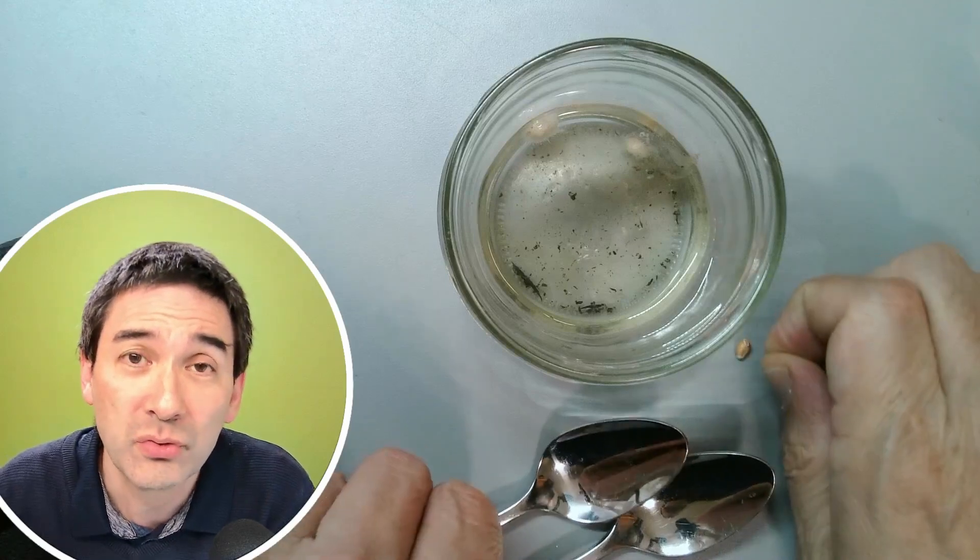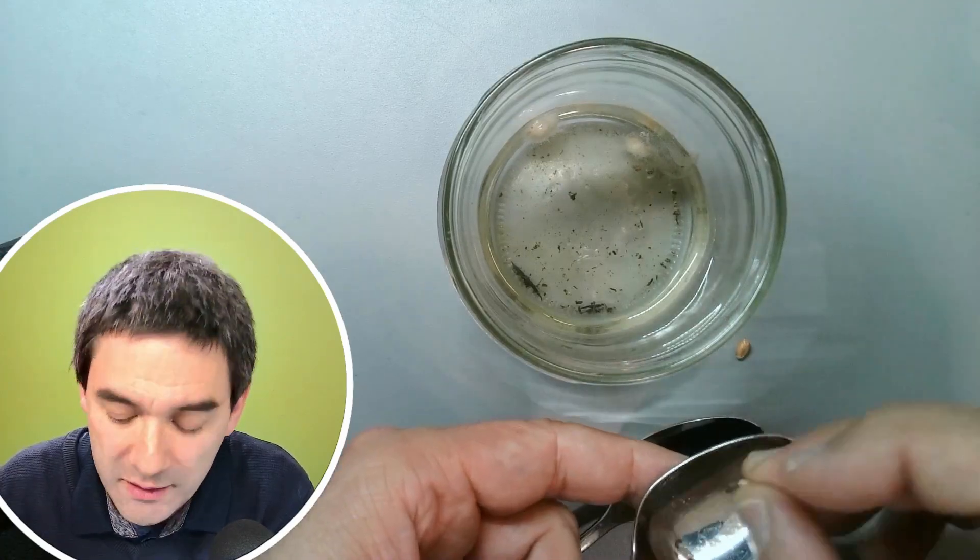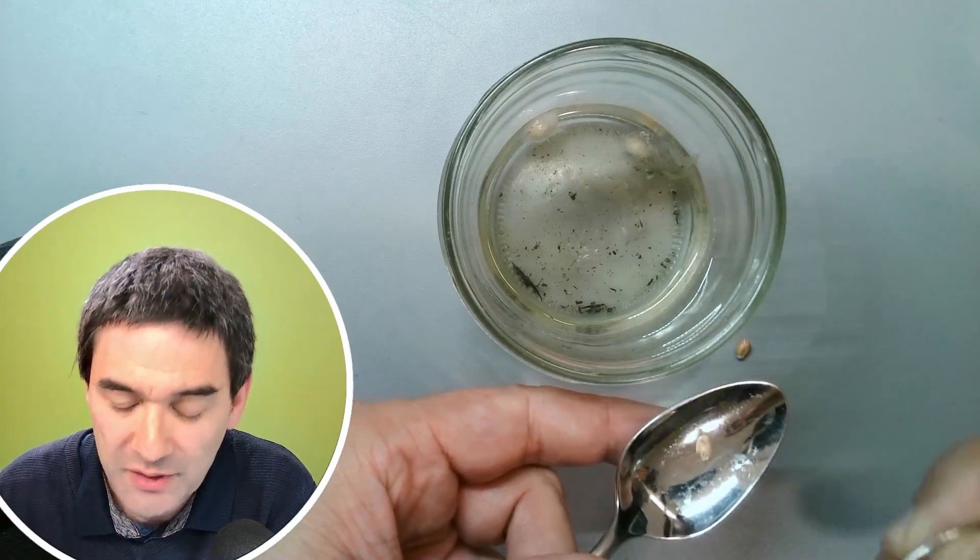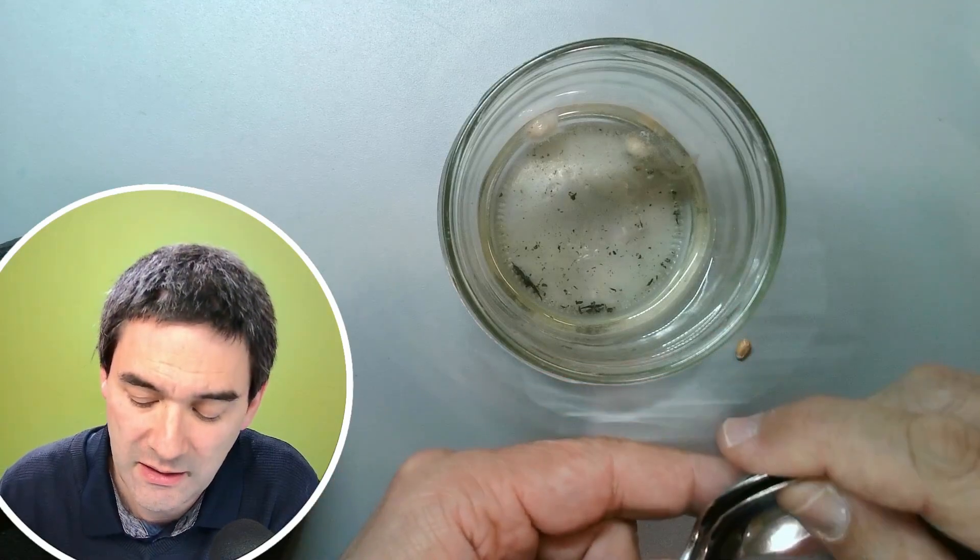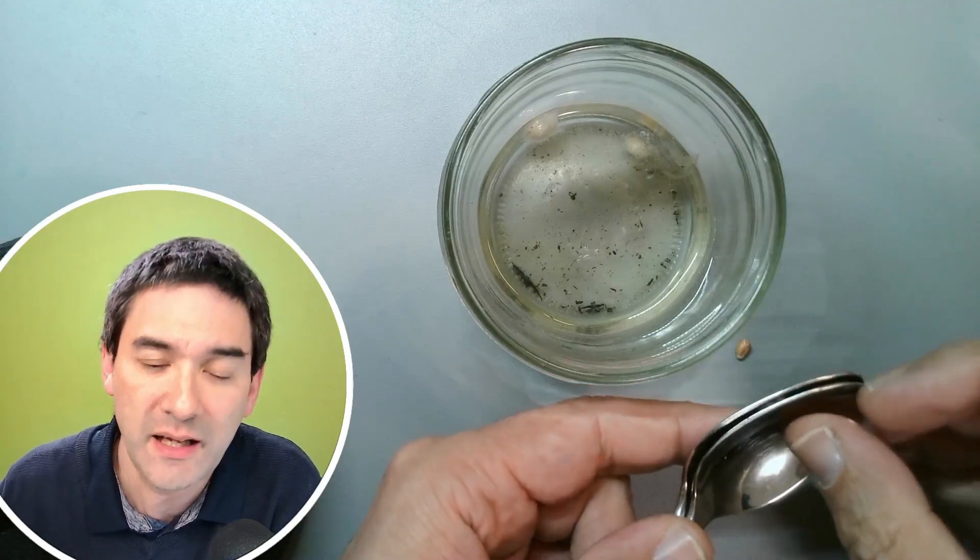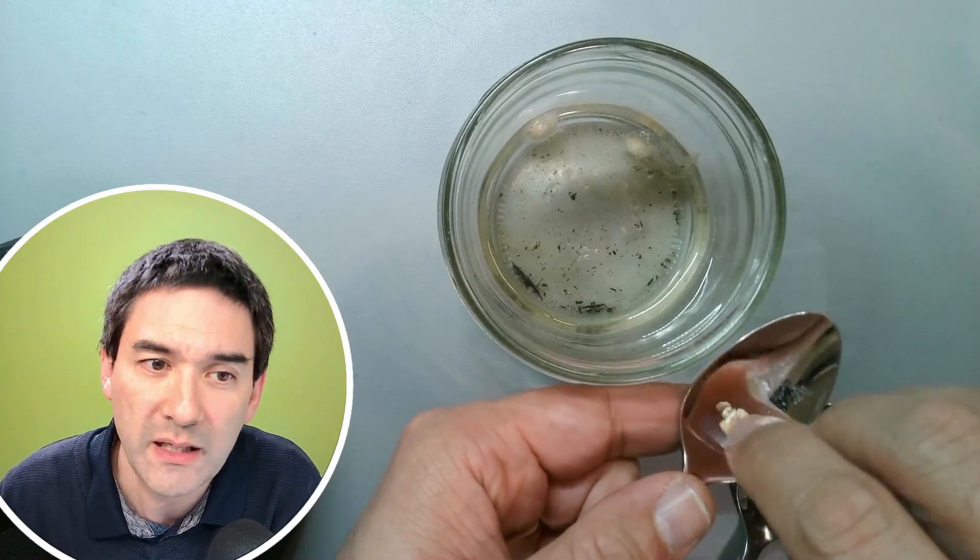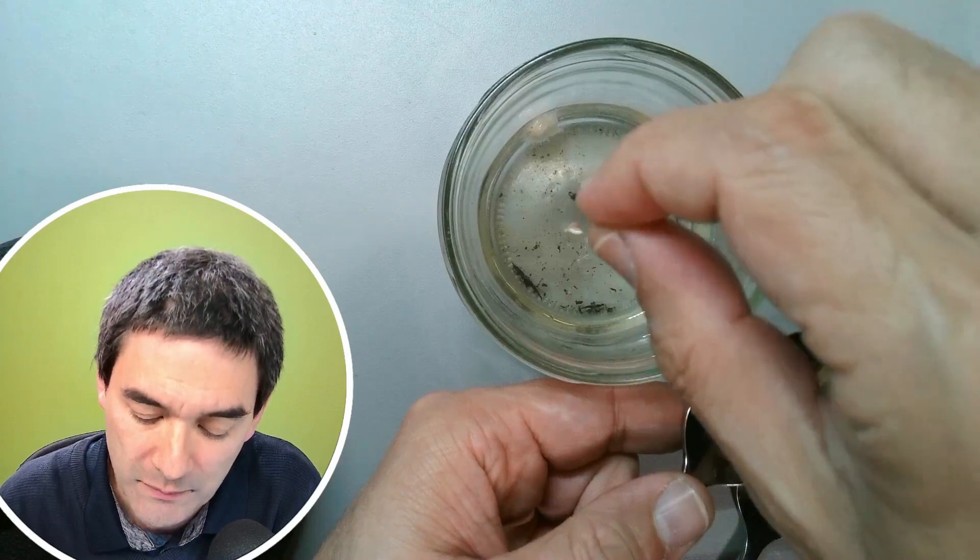If you want to grow those microbes yourself, you need two spoons. I've got a wheat grain, a cereal grain, in here. What you do is just crush the wheat grain between two spoons, just like this. You have to press. Then you take this crushed wheat grain and simply drop it into the water like this.